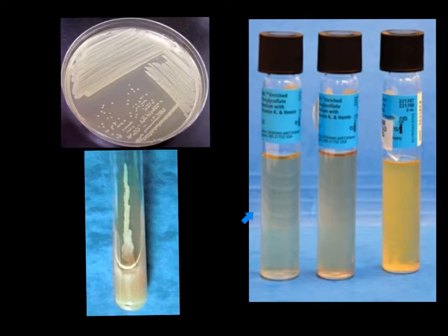We also do not want to thump the test tube so hard that we splatter solution outside, but we do want to thump it enough that we get a swirling motion inside so that we can evenly distribute the bacteria throughout the broth.